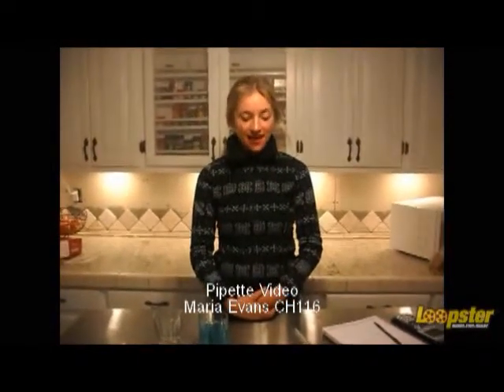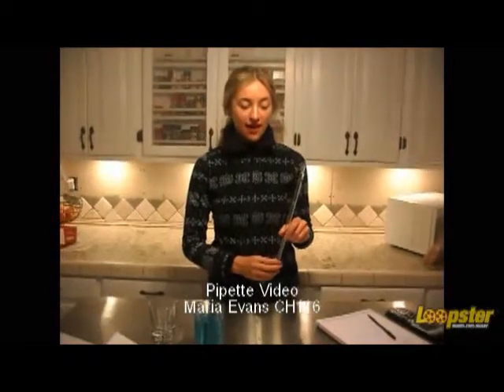Hi, I'm Maria Evans from Chemistry 116, and today I'll be demonstrating how to properly use a glass graduated pipette, and then how to calculate total volume with said pipette.